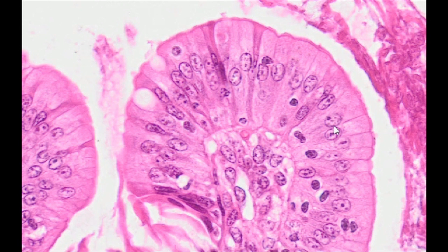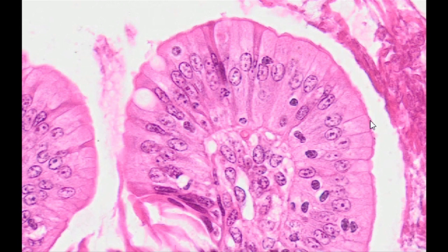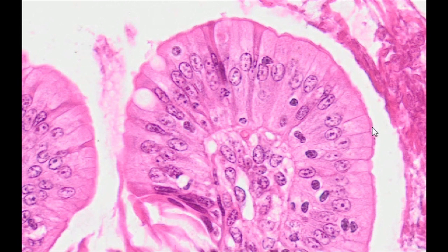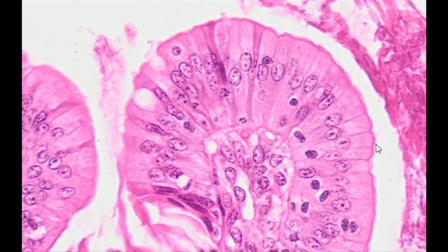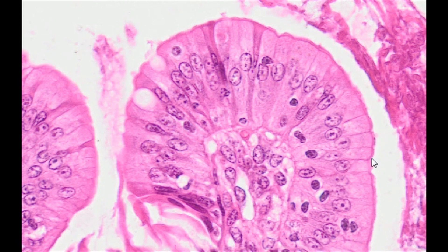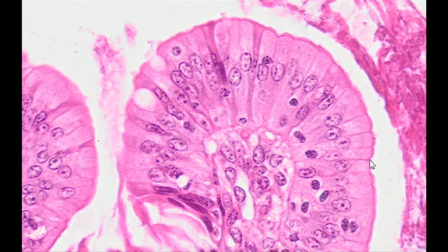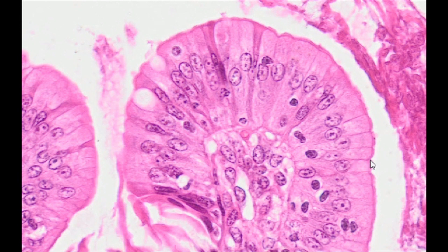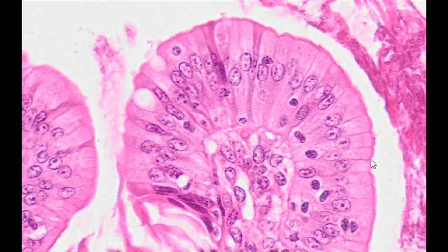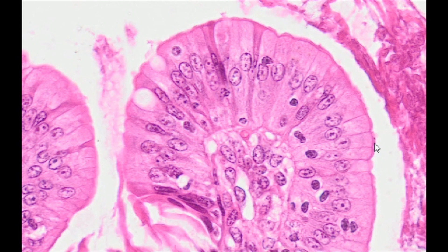Depending on the location of this epithelium, characteristic structures may be present on the apical surface of its cells, such as cilia in the fallopian tube, microvilli in intestinal epithelium and renal tubules, and stereocilia in the epididymal duct.